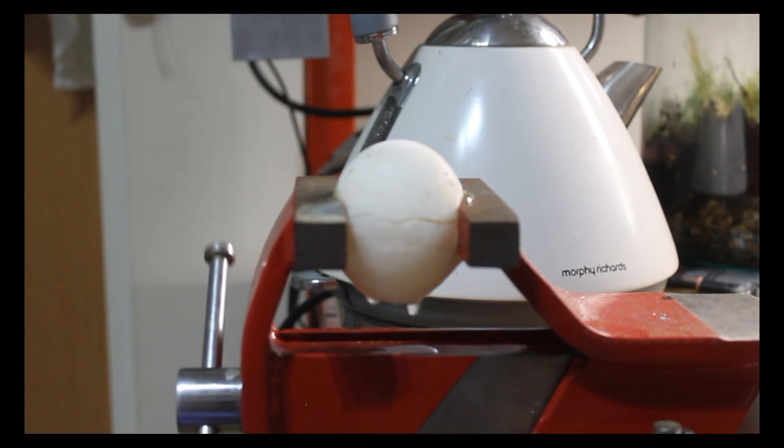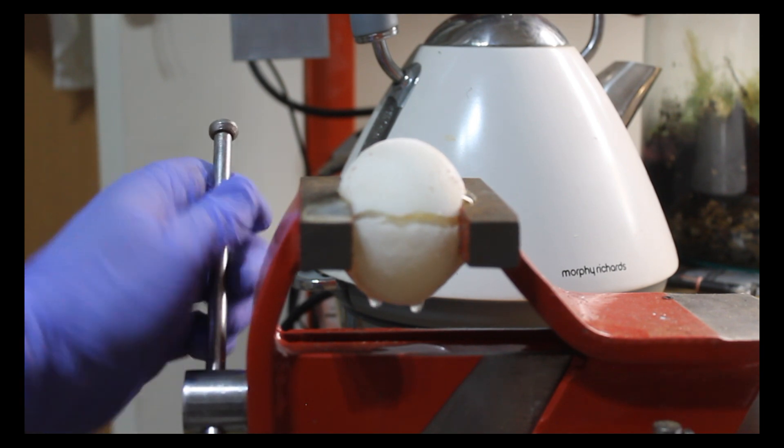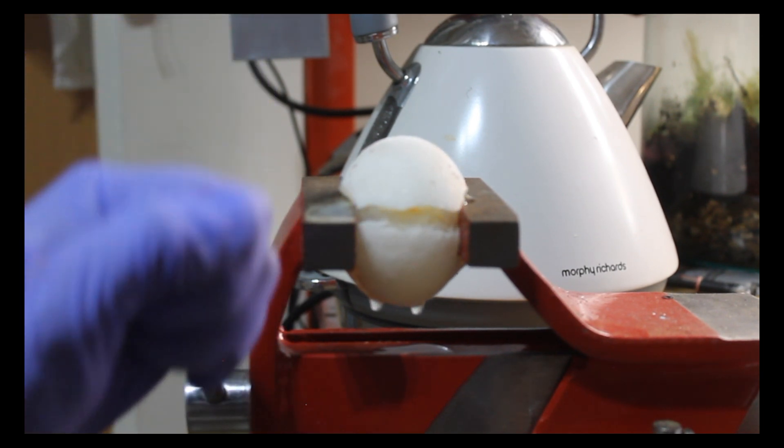At this point the membrane of the egg has begun to crack and we see it start to open.